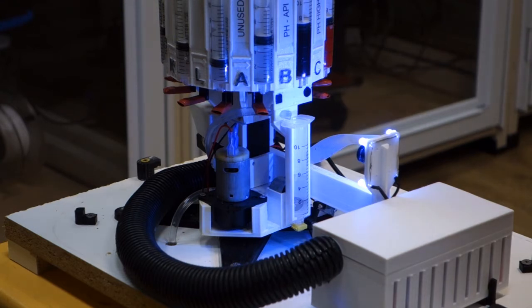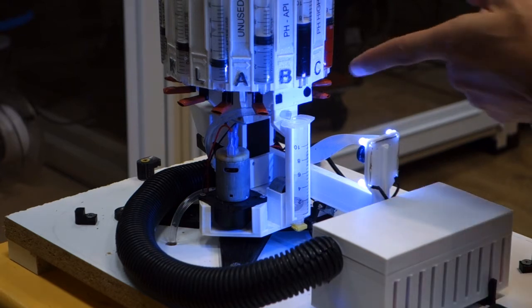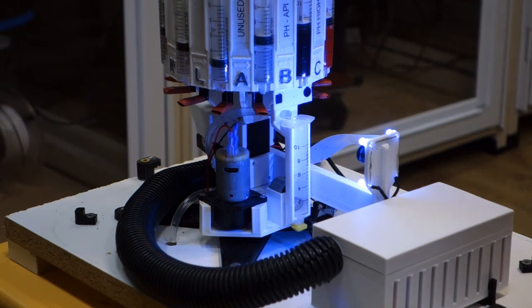But what it'll do is once it hits the plunger it's going to slow down and you'll see 3 drops being dispensed. This will be a few seconds more. If this had been a test that required agitation there would have been activity occurring inside that cylinder. Some tests require more than one reagent and of course it accommodates that by dispensing multiple reagents. It's about ready. You'll see the first drop, second drop, third drop. Now it's backing off. Mixing it.